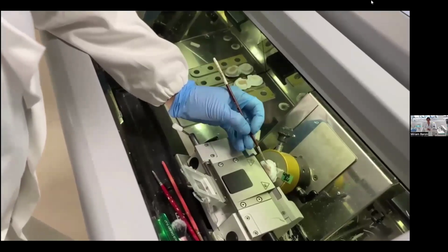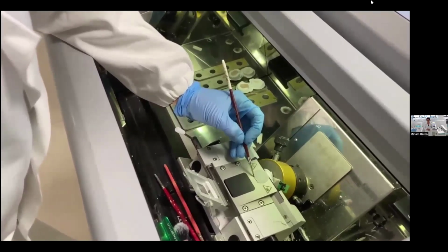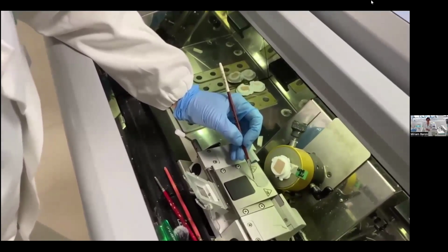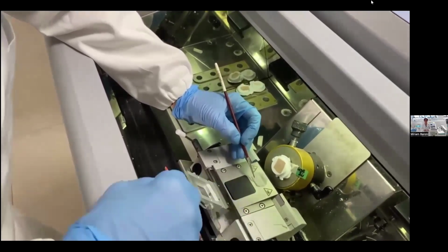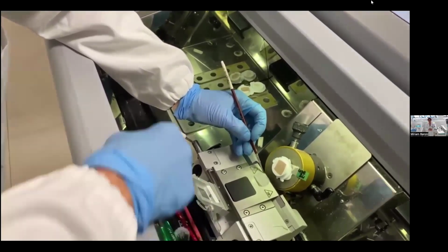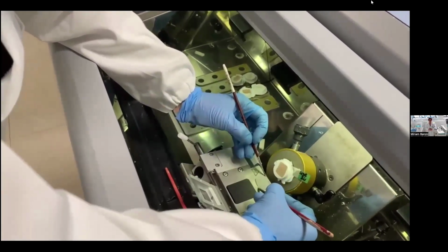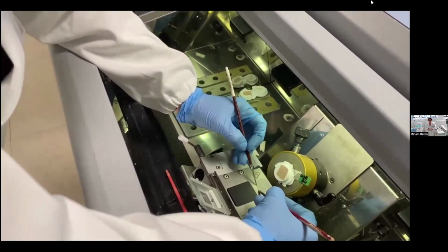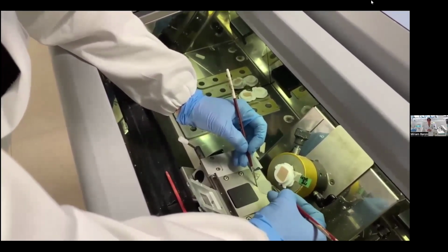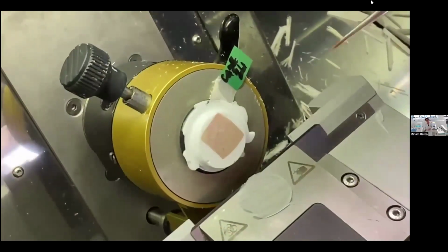During the sectioning, I don't have any shattering effect, because a short freezing of 30 seconds at minus 40 degrees in PrestoChill allows me to have the block at the correct cutting temperature for this type of sample. This sample is kidney and requires an ideal cutting temperature of minus 20 degrees. But with the PrestoChill, we can have a warmer or colder block.